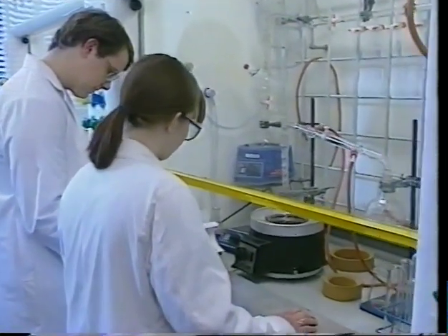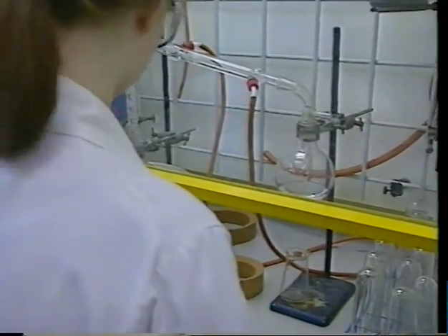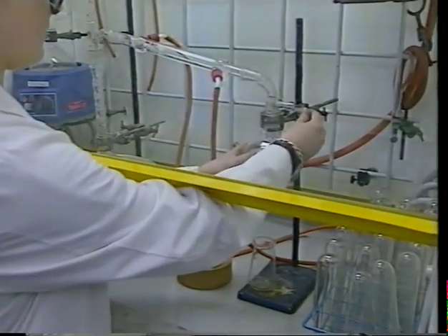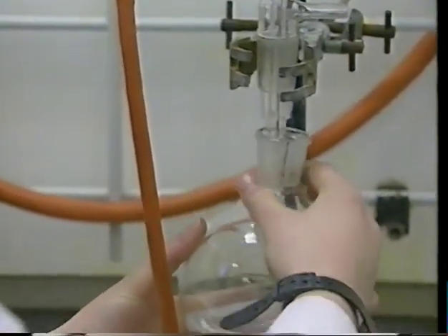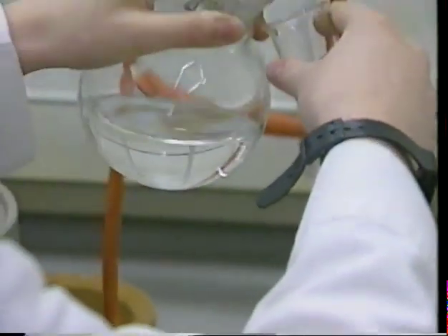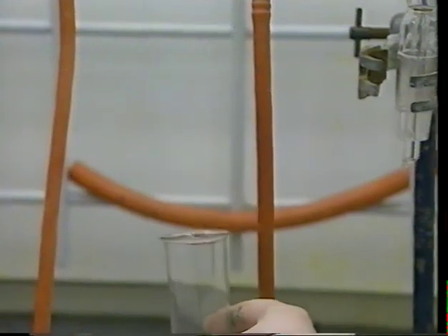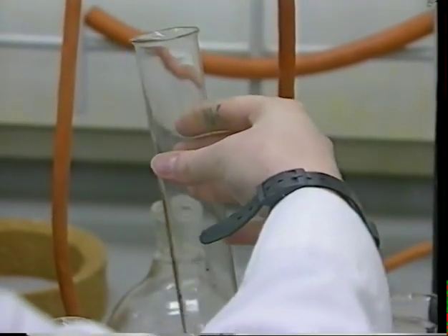Chemists are frequently involved in either producing completely new compounds or developing alternative methods of producing well-established compounds. In either case, it's obviously essential that we're able to identify accurately any compound we produce in the laboratory. Chemical tests are usually destructive and could easily use up several weeks' worth of new material in one go.